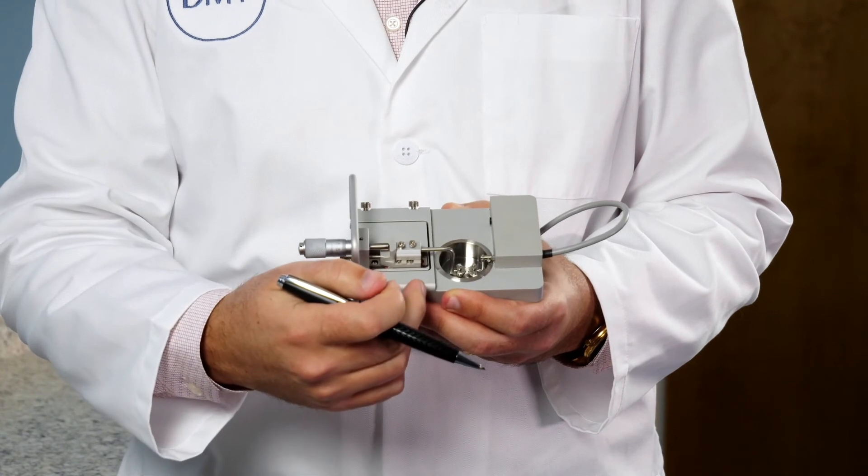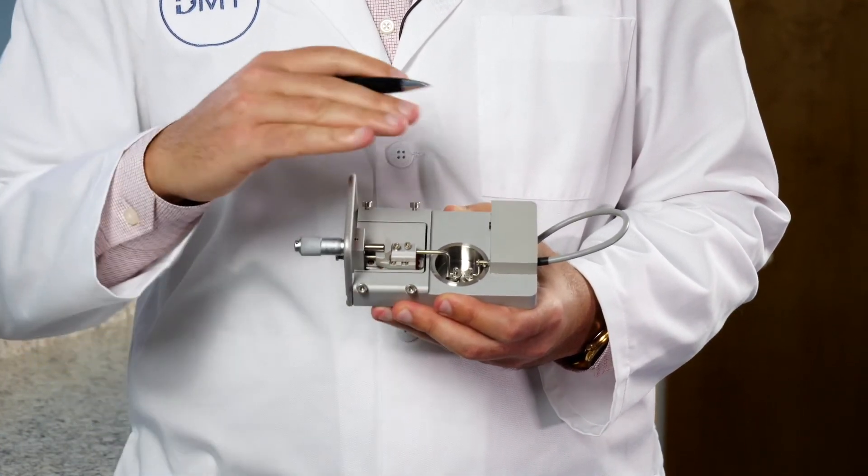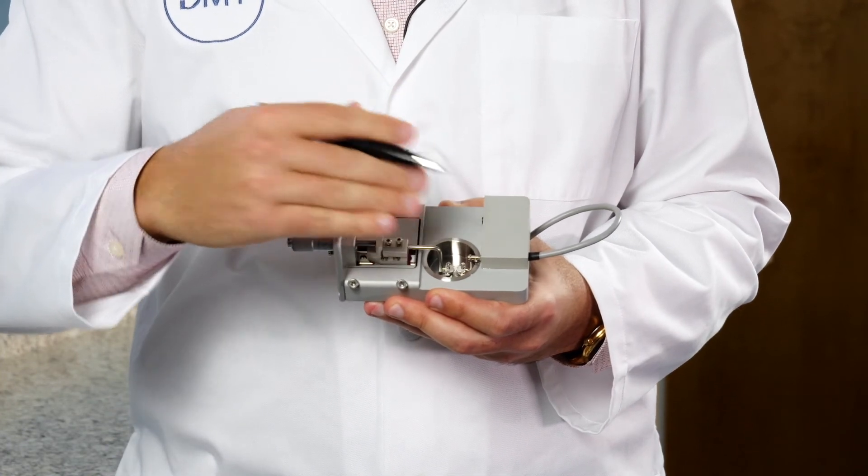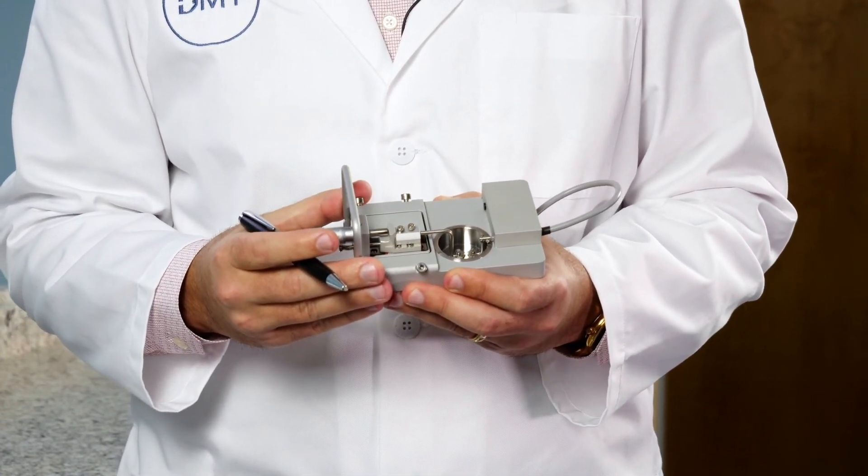So as you tighten the front right screw, it is going to push the chamber down and to the right. So you will keep that in mind as you try to align your mounts.